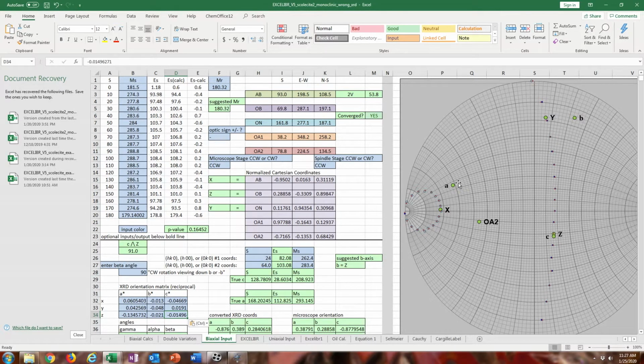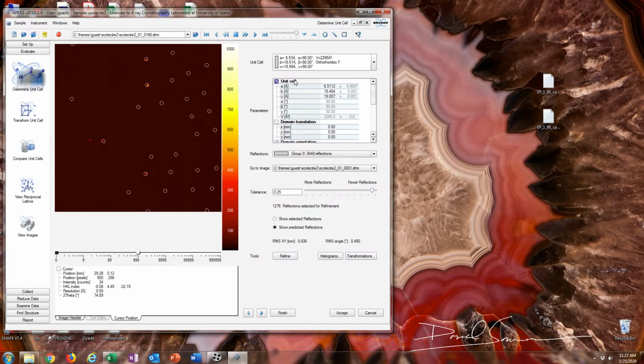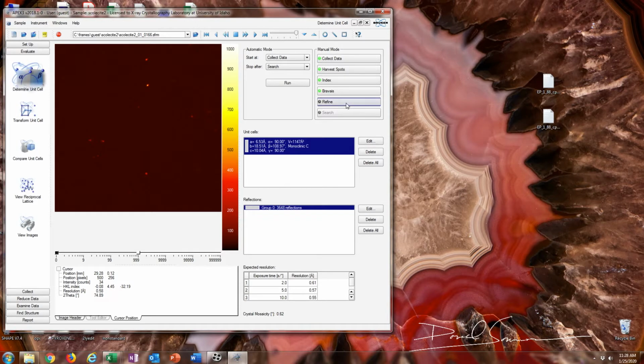So what we see is that C is equal to Z, but A and B don't correspond to X and Y. So if the optical vectors don't correspond to the crystallographic vectors, the principal optical vectors, then it cannot be orthorhombic. That makes no sense. So we know that it has to be monoclinic of some kind, because one of the crystallographic axes does correspond.